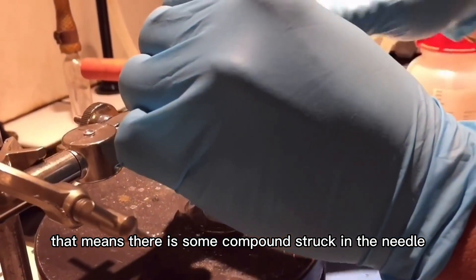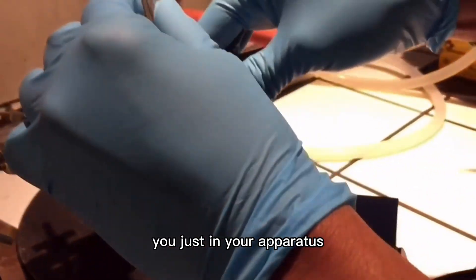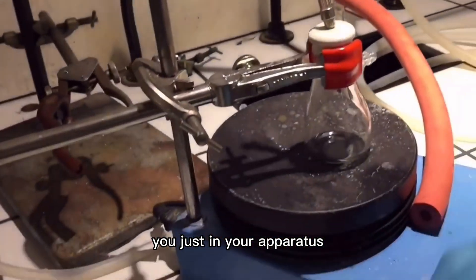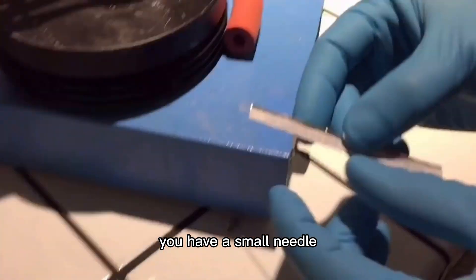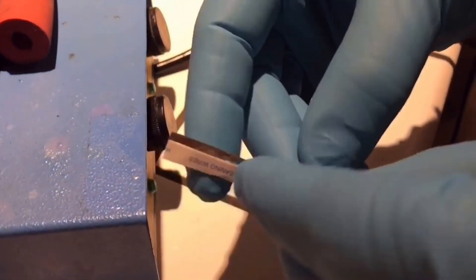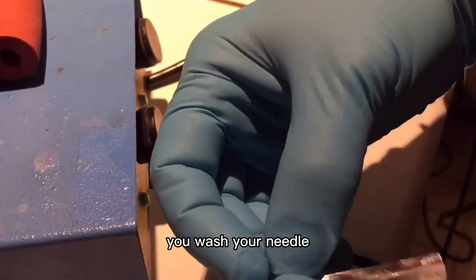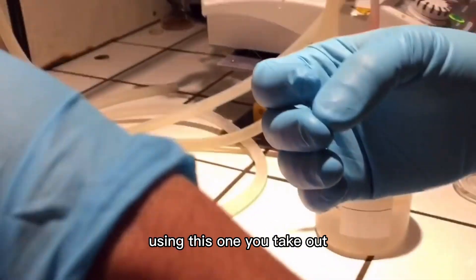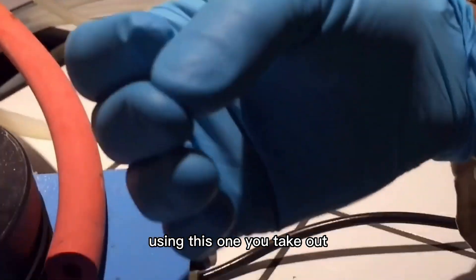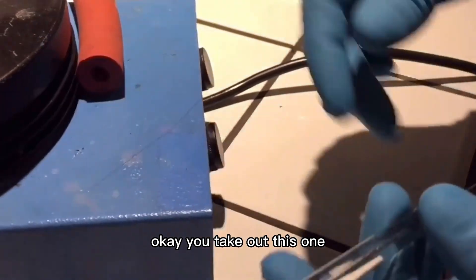When compound is stuck in the needle, you have a small needle available in your setup. Using this one, you wash your needle. Take it out like this.